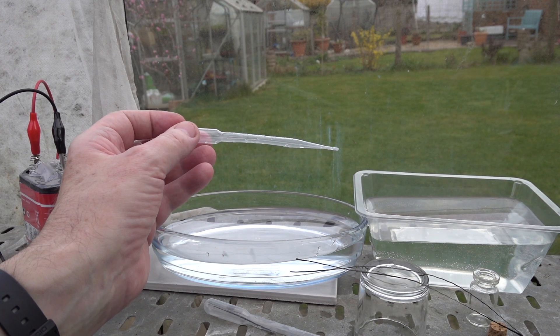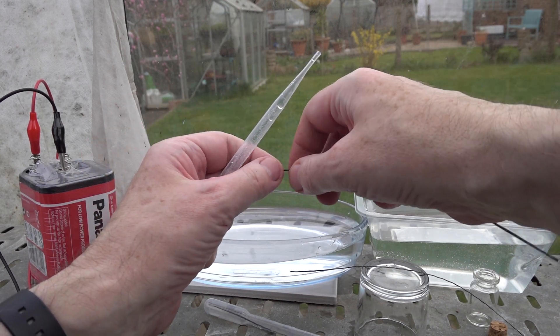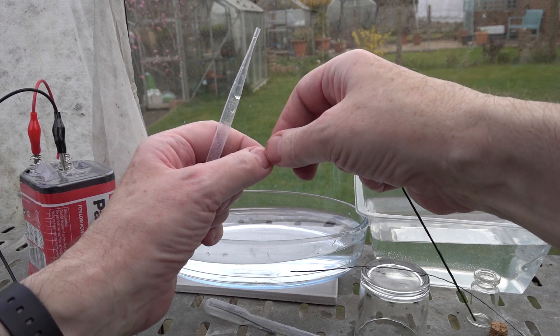That's how you collect the gas. So again, if we take one of the fibers, this one's been used before. That's another advantage of the method: the materials can be washed and reused.